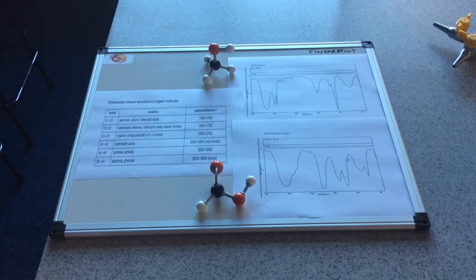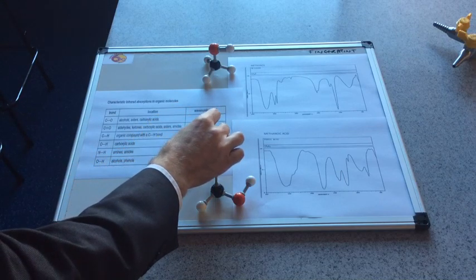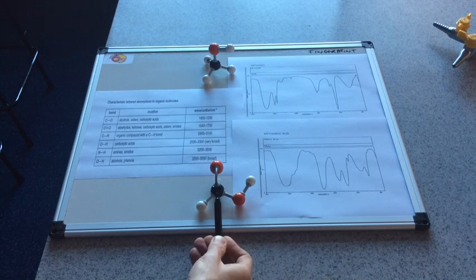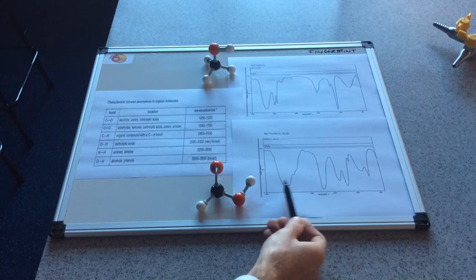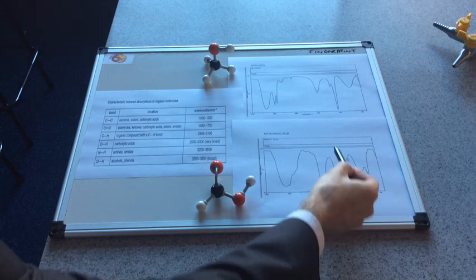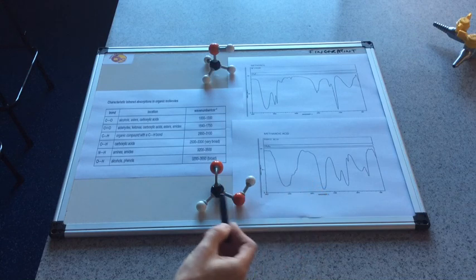The other thing to note is that in a carboxylic acid we also have a C double bond O, and you can see from the table that carboxylic acids contain this bond and it absorbs in the 1640 to 1750 region. There's 1500, there's 2000, so this absorption here is due to the C double bond O. So on an organic spectrum when you see this strong absorption here and this broad absorption here, that's evidence that we've got a carboxylic acid. The main features are the OH and the C double bond O.